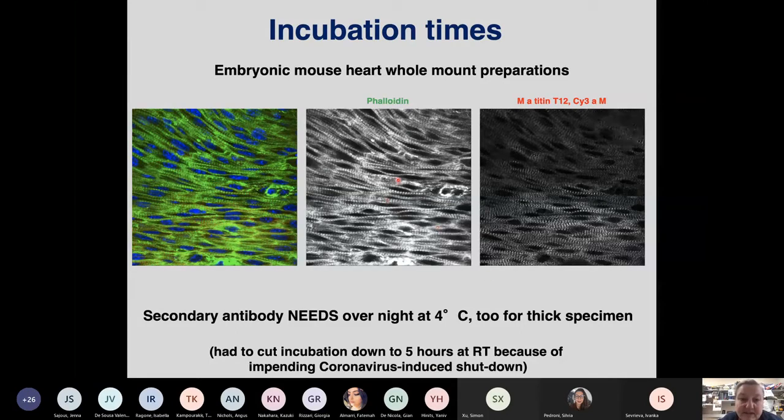We are desperate. Well, anyway, what you see here is that for the phalloidin, which is a really, really tiny compound, the diffusion in 5 hours was no problem. So you see this homogeneous signal throughout this field, and the intensity for the phalloidin is completely the same on the outside of the heart and on the inside of the heart. Now, unfortunately, this was not the case for the secondary antibody. So for the Cy3 anti-mouse, you see this gradient of signal. And you know that the primary had no problem getting there, because it had the chance to react overnight. But we are not seeing the primary antibody. We are only seeing the Cy3 that sits on the anti-mouse secondary antibody. And if we don't give it enough time to diffuse through, to react with all the primary antibody that's around, then we will have this gradient. And again, it may lead to a misleading conclusion.